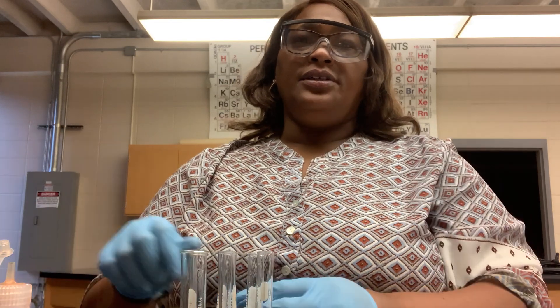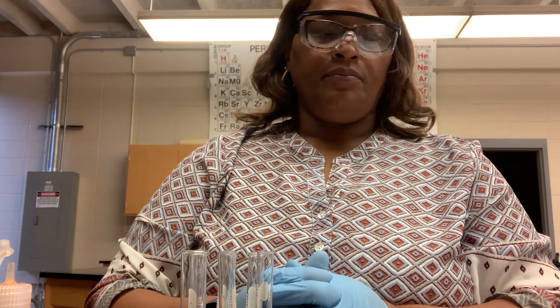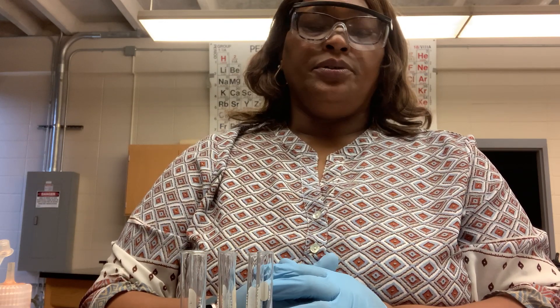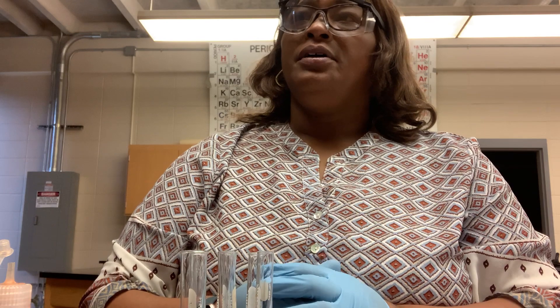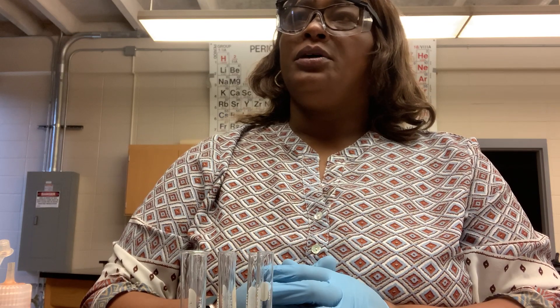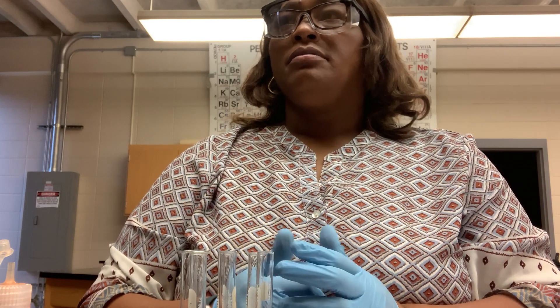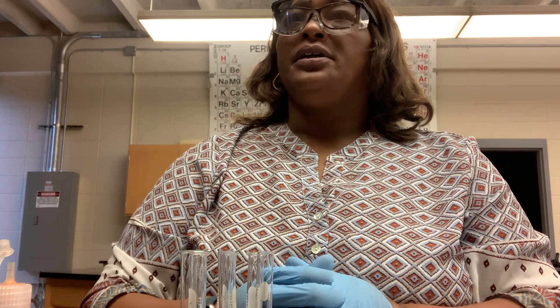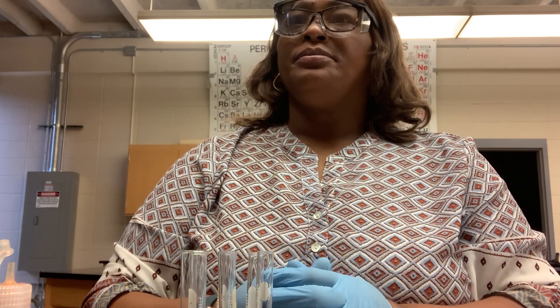Now that we've tested each of the three liquids with the two different indicators, consult with your group members on determining the pH range for each of those liquids based on the color or colorless nature of the resulting liquids after you added each type of indicator.